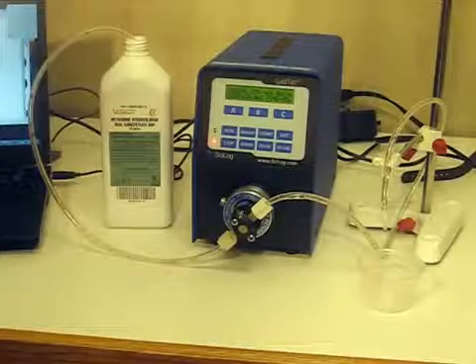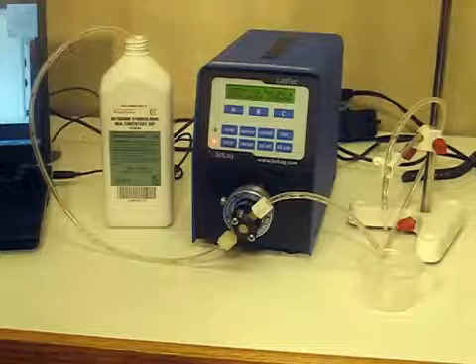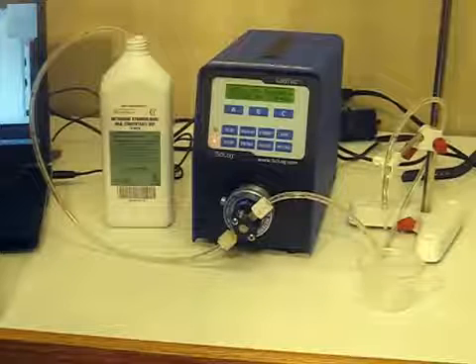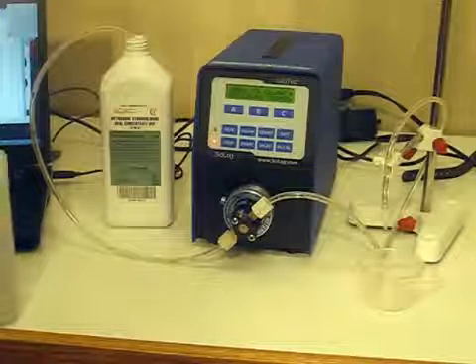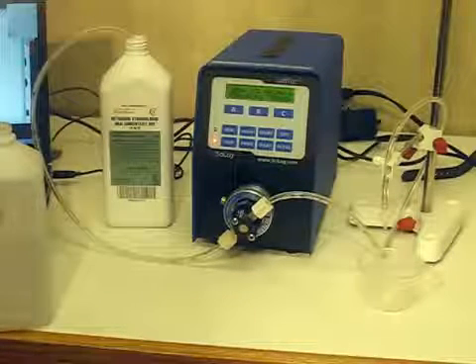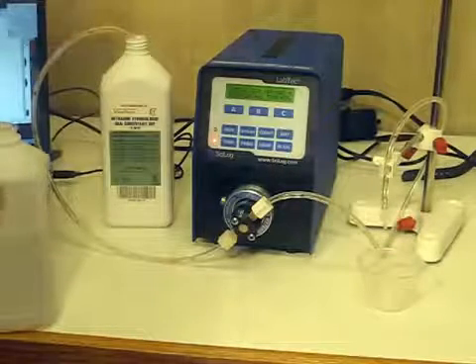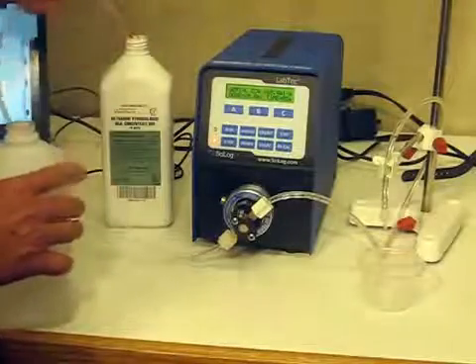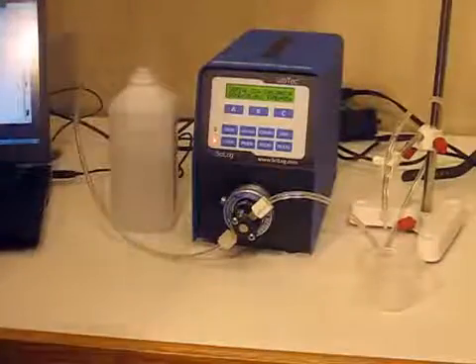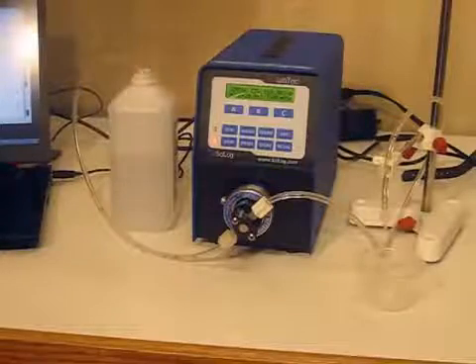For maintenance of your methadone pump and the piston head, we recommend that at the end of every day you flush the system for a long period of time using either hot distilled water, or one of our major recommendations is using 50% isopropyl alcohol and 50% distilled water and flushing it through the tubing. You replace the methadone bottle by using your flushing liquid, and then we flush that through for a period of time.